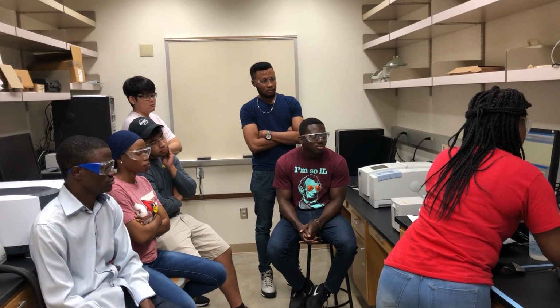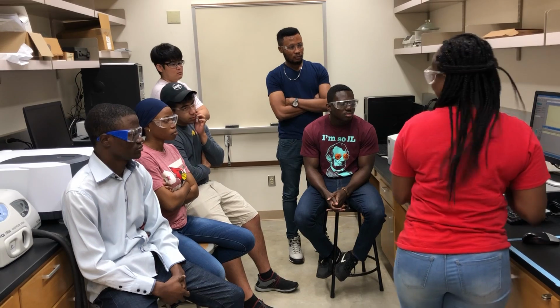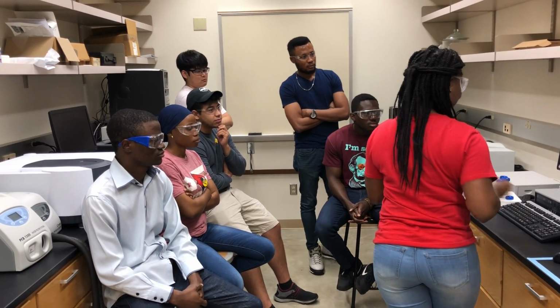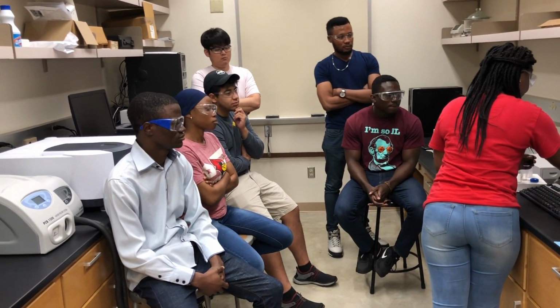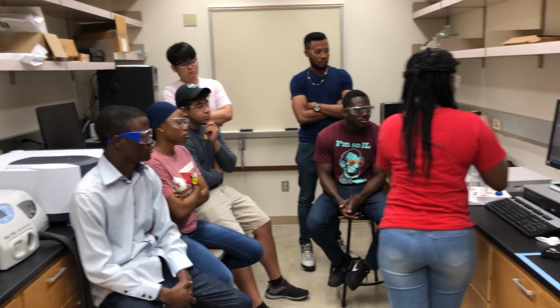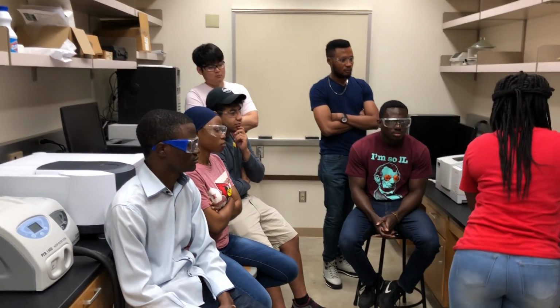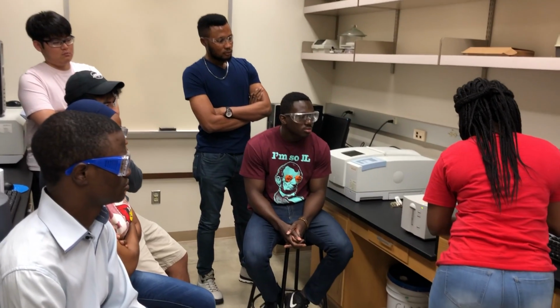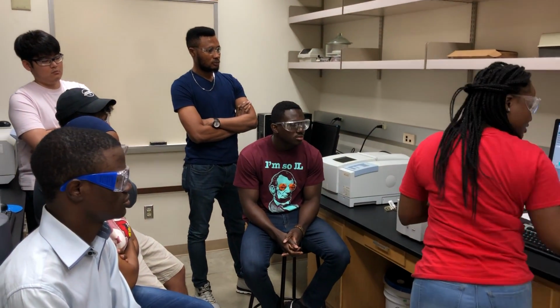Let's try the last one to see. If you have any other question in your mind, just let me know. This is kind of simple now, but it needs practice. Change the tip for the next sample. Do the same again. Dilute.